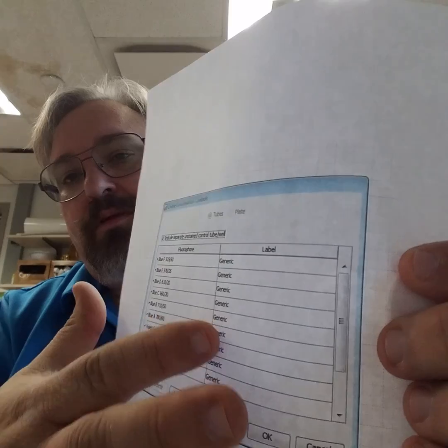A second powerful tip about DIVA is that if you have multiple fluorochromes in the same channel, you can add multiple fluorochromes down here and then label them rather than having this generic tag. And that will allow you to have tube specific compensation based upon the antigens that you've chosen.